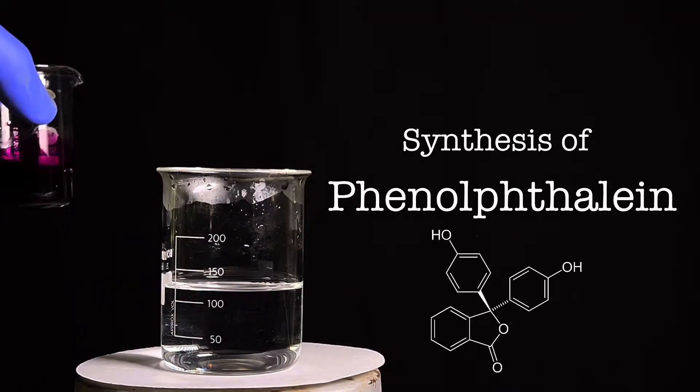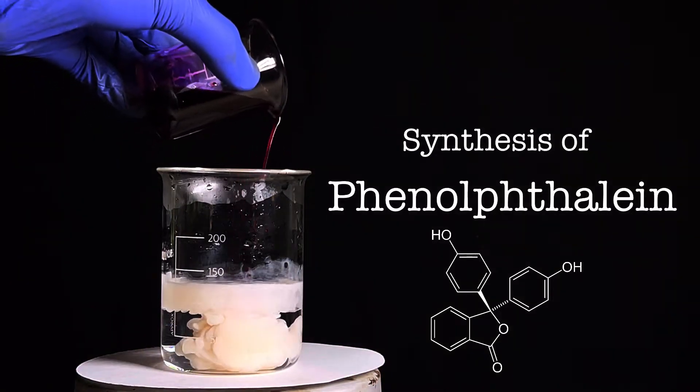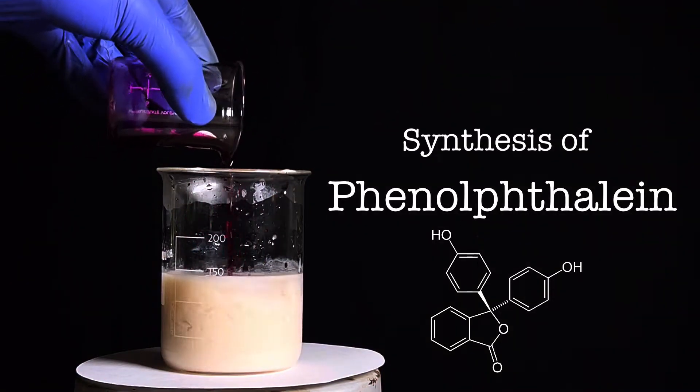Hello friends, in this video we will be synthesizing phenolphthalein from phenol and phthalic anhydride through the phthalein dye reaction.